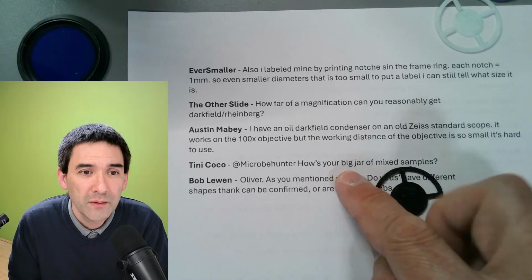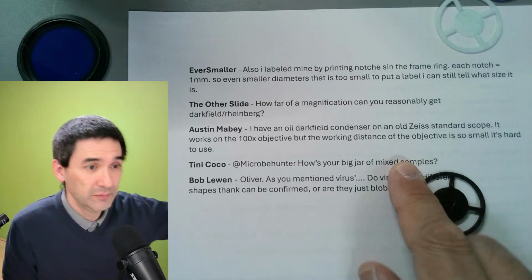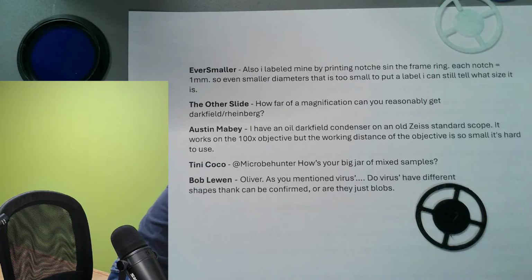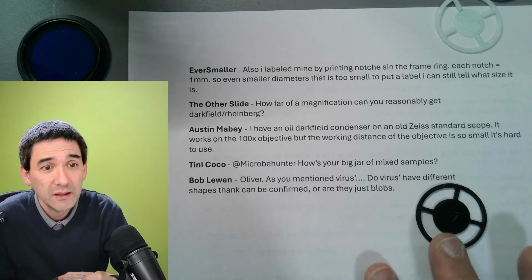Yeah. How's your big jar of mixed samples? It's over there. I'm gonna show you, and it's, I don't know, it looks messy.